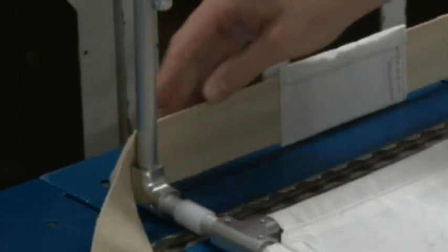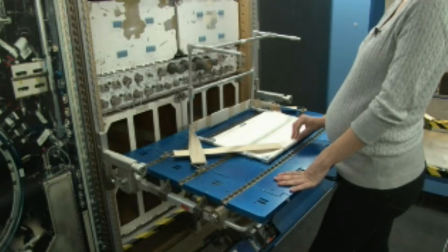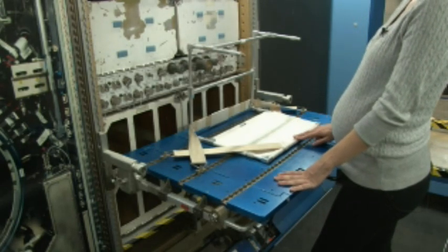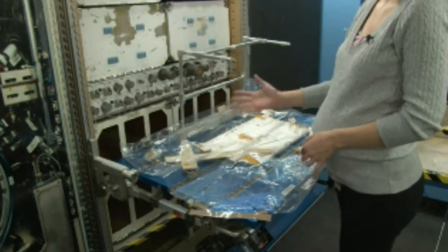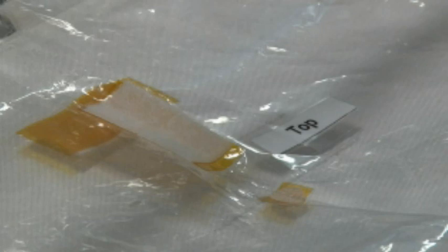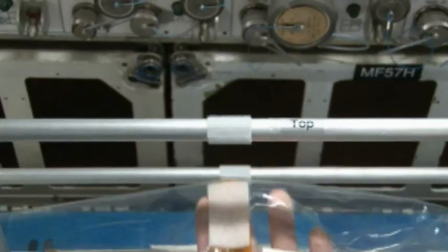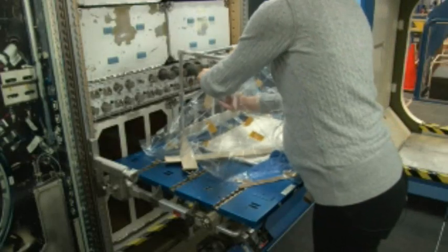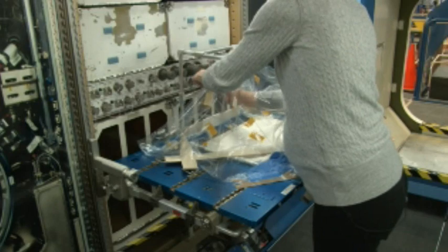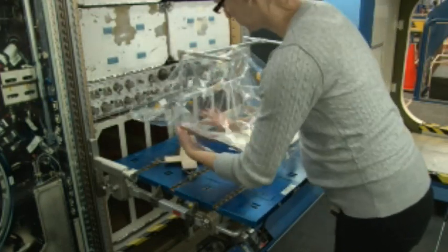You can wiggle it to make it straight, making sure the Velcro in the front bottom of the frame is available in order to attach the glove bag. In order to determine if you have it right side up, there's a top label that will mate the Velcro to the top of the glove bag frame. Once the glove bag is securely attached to the glove bag frame, place all contents of your experiment — hardware, tools, and consumables — inside the glove bag.